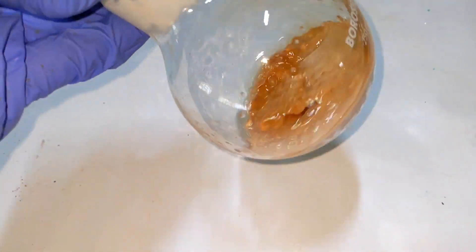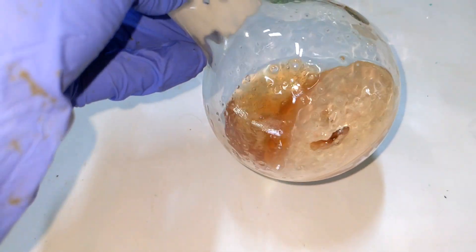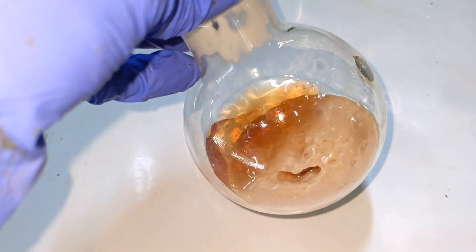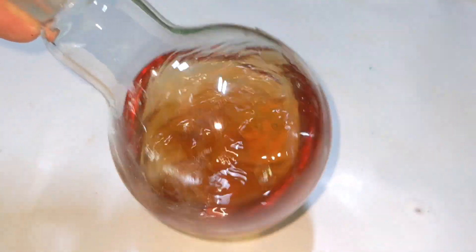To prevent excess addition of water, add water in small quantities at a time and then vigorously shake the flask so that the solid will dissolve in the least amount of water.